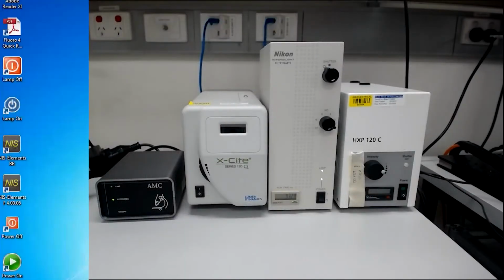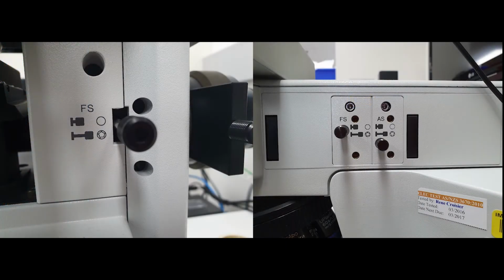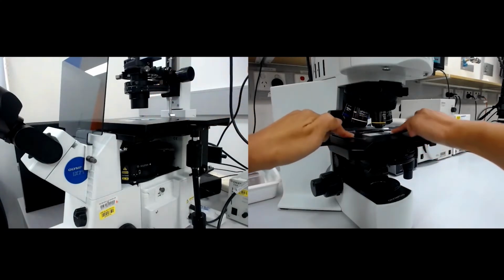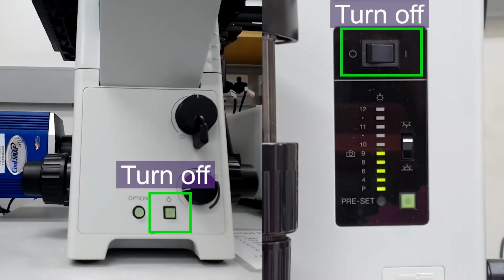For fluorescence imaging, make sure that the epifluorescence lamp is on, the light intensity is stable, the neutral density filters are removed, and the field and aperture stops are open to begin with. Mount your sample on the microscope with the cover slip facing the objective and focus on the sample. Make sure to turn the bright field light off.